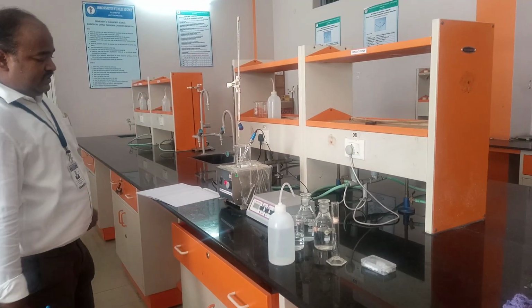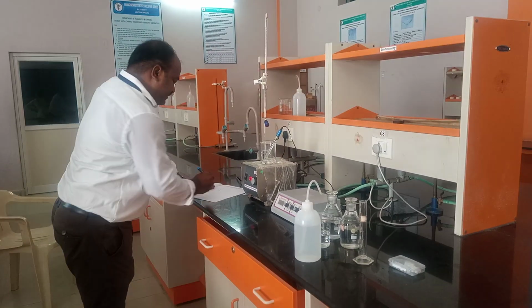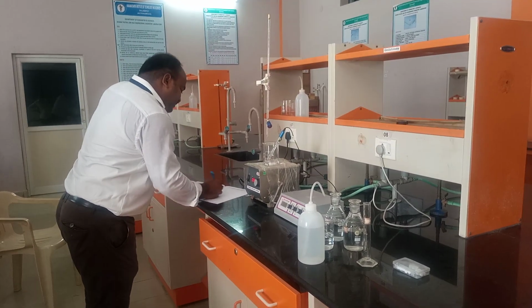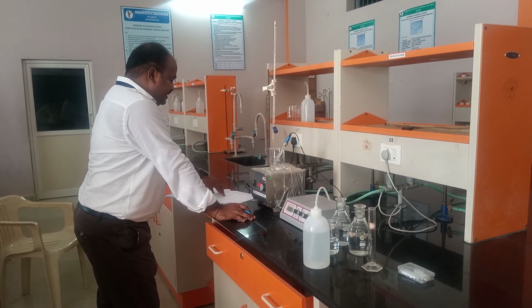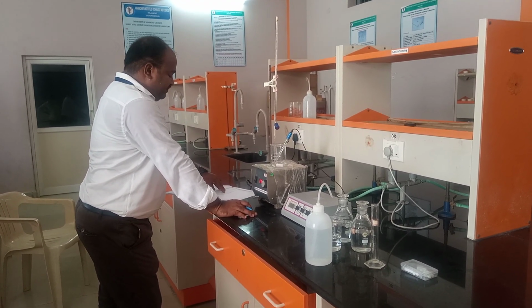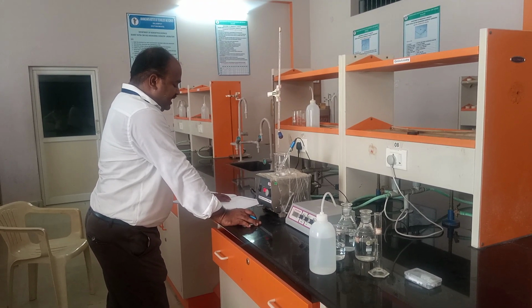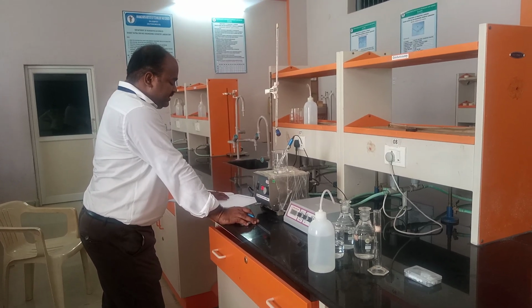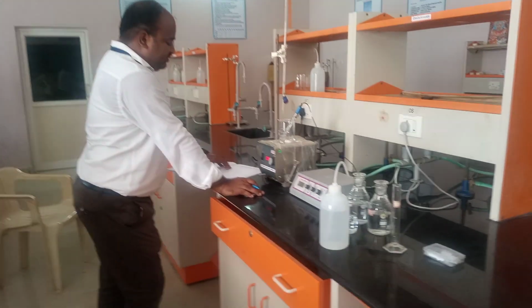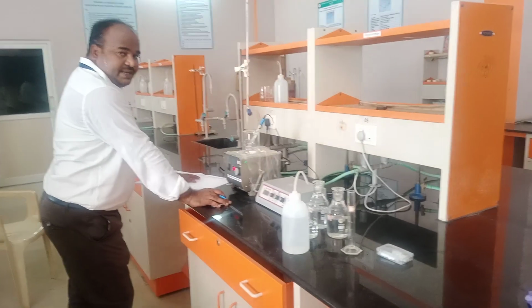Now it is almost 10.3. So the value will be very similar from 0.64 to 1.12. From 1.12 the value changed drastically from acidity to basicity. Directly it jumped from acidity to basicity. Why? Because 1.12 is acidic pH, whereas 9.5 is basic pH.